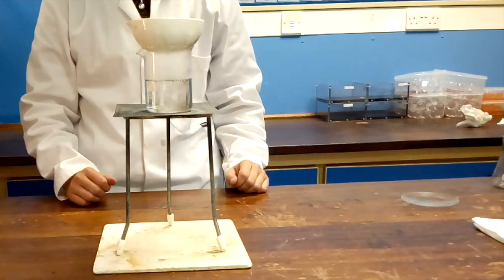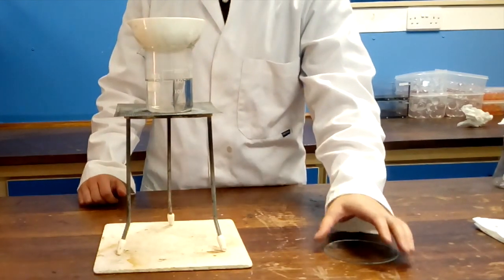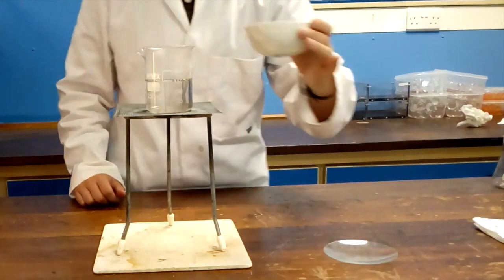Now you will need to allow your equipment to cool down to room temperature. Again this takes a while and so you will have to be patient. Once the dish is safe to handle transfer the solution to your watch glass.